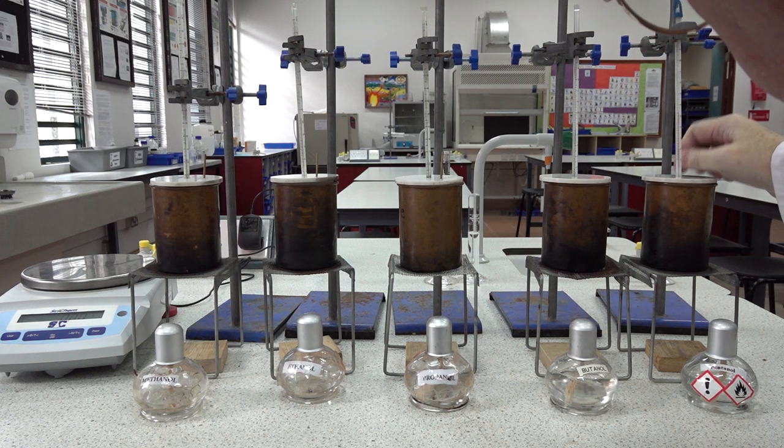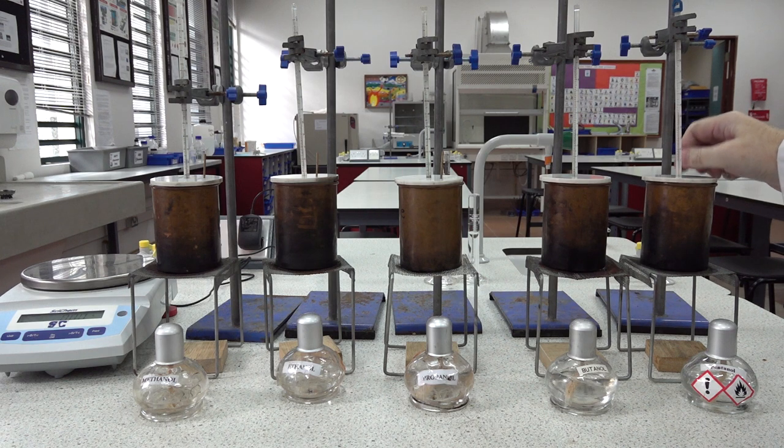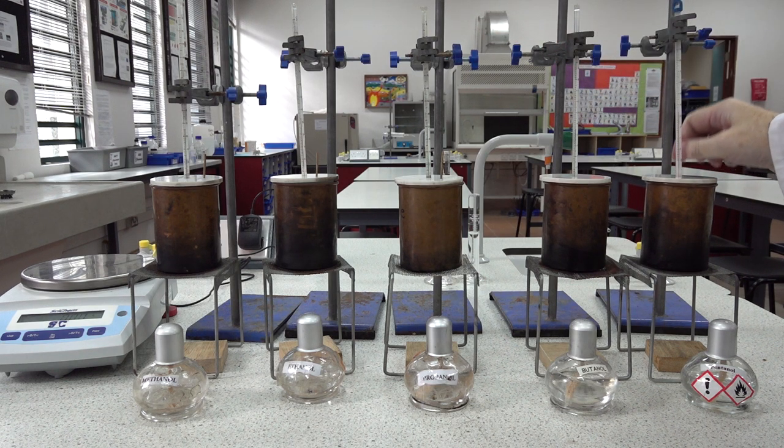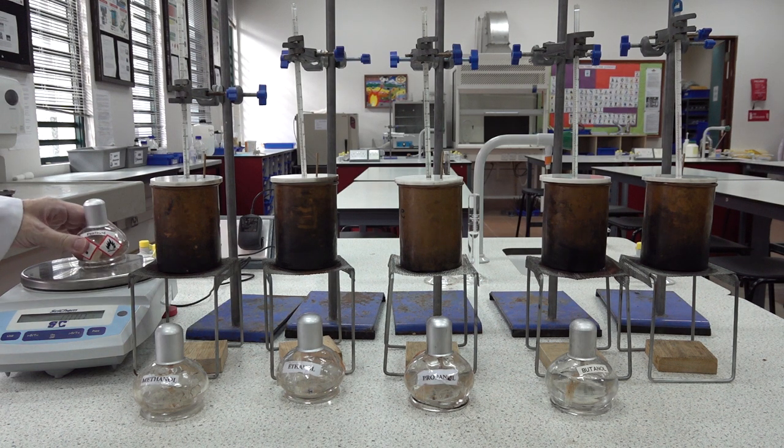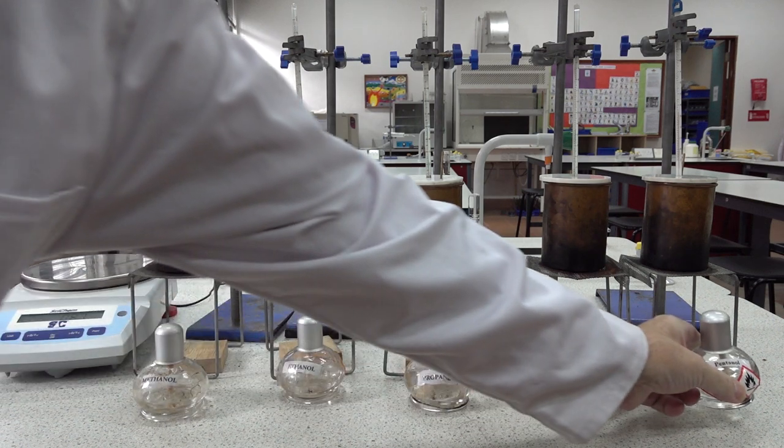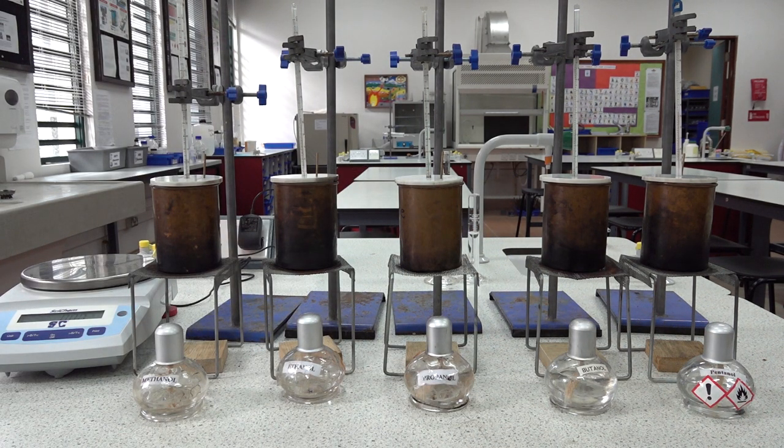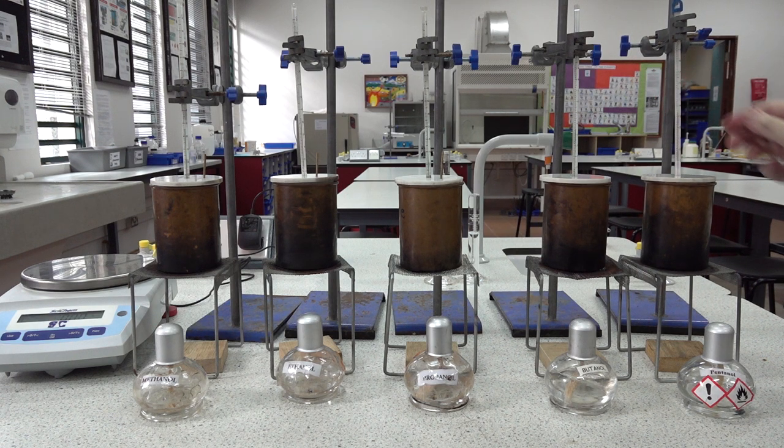The accuracy of our thermometer. 34. Let's re-weigh the pentanol: 215.34 grams. And the thermometer reading is 34. Oh, it is over 34 and a half. 34.5 maximum temperature reached. So on to the last one, which is our methanol.